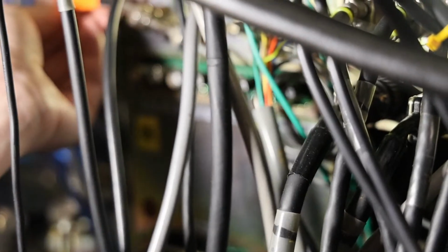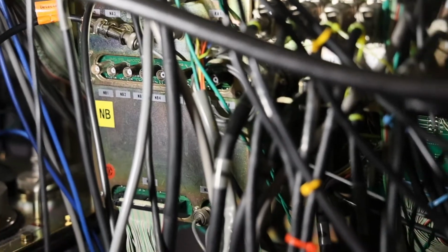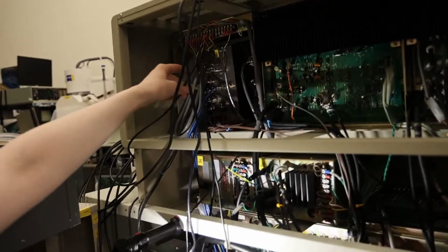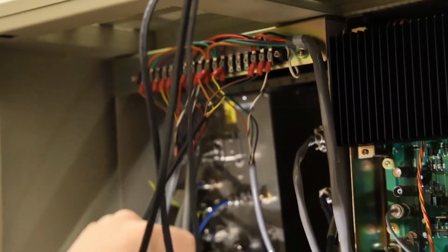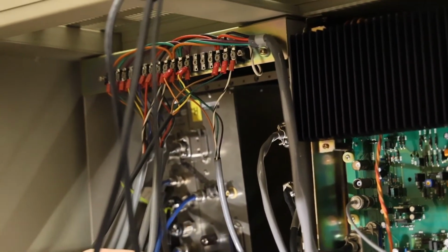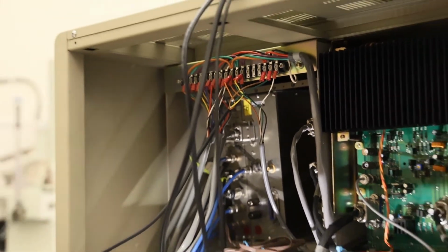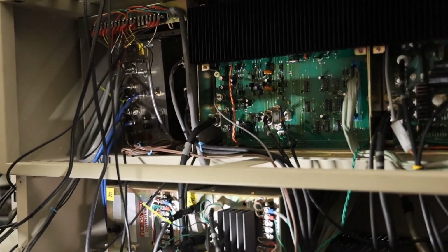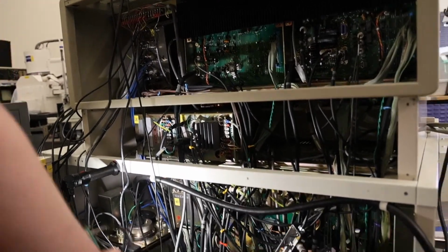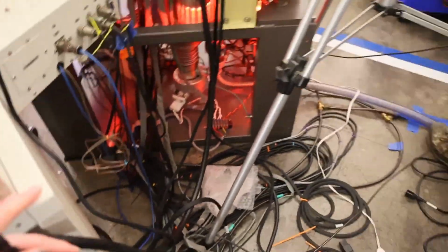So now we've got our detector signal teed off of NA7, and that's basically everything that we have to do behind the microscope to install open beam interface. I also put a power cable in for open beam interface up here. This power cable is run off of the accessory power supplies. So that gets us our ground, our 5 volts, and our plus and minus 15 volts. By utilizing the power supplies that already exist within the microscope, we adhere to the microscope's grounding architecture and power distribution architecture and minimize the potential for ground loops or other issues of the sort. So let's go around back and finish plugging cables into OBI, and then we can go ahead and get an image.